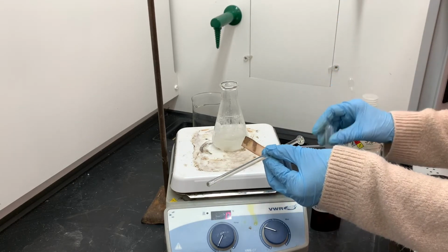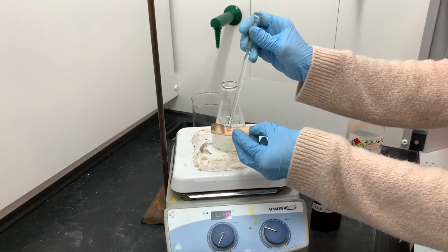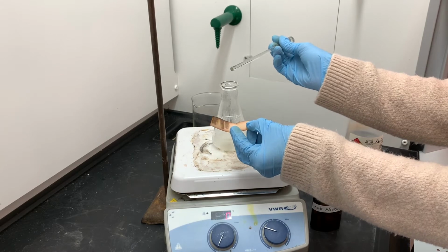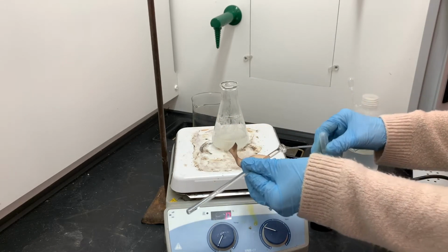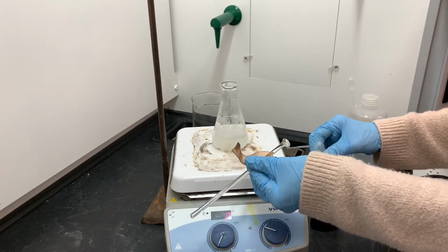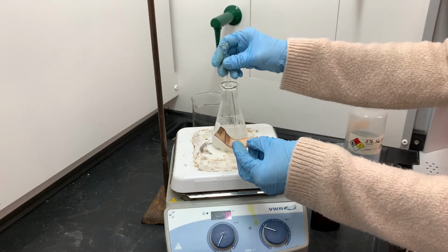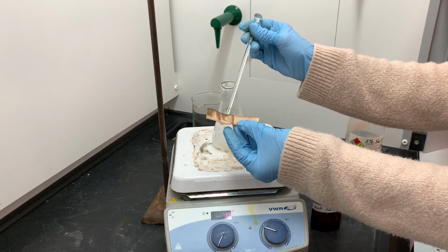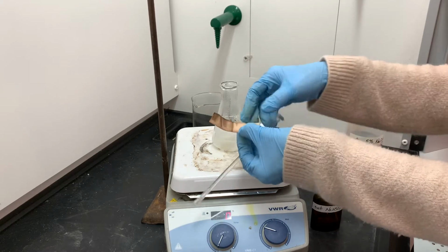And again, this is almost in a way more challenging than doing a similar type of thing with pH, because the starch-iodide paper just gives us a yes or a no. There isn't really indication of how close we are getting to being done here. We just have to keep adding and testing and adding and testing. And sometimes it takes a lot and sometimes it doesn't take all that much. But you'll see when we get all the way done with this that when I test with starch-iodide paper, it looks just kind of white on the paper.